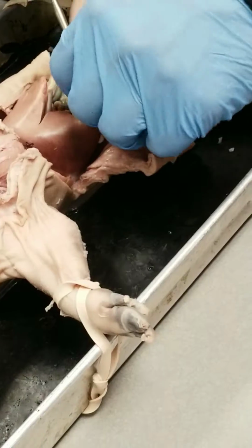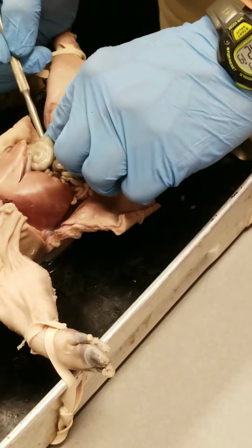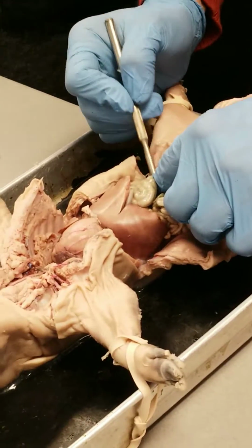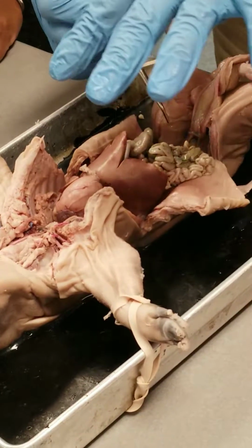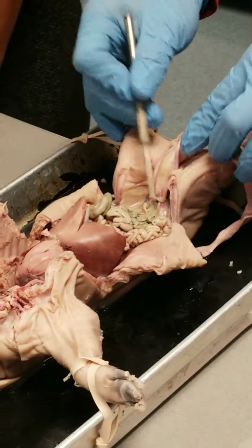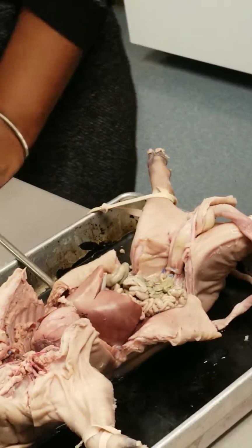One of the things that we'll do moving forward is work along that posterior body wall to identify the inferior vena cava, to identify the abdominal aorta, and then to look at the 4 branches off of the abdominal aorta. 2 of them are these umbilical arteries. The other 2 are called external iliac arteries. So anyway, that's most of what you got.